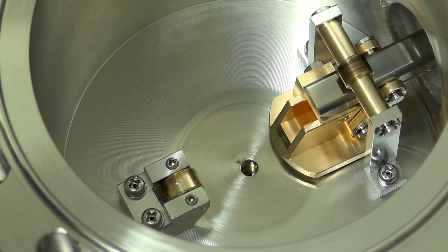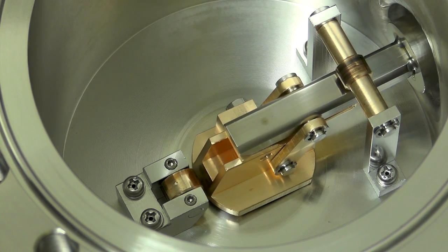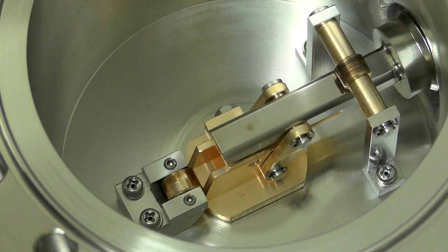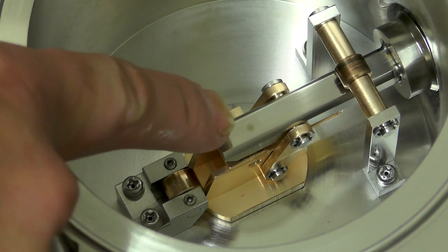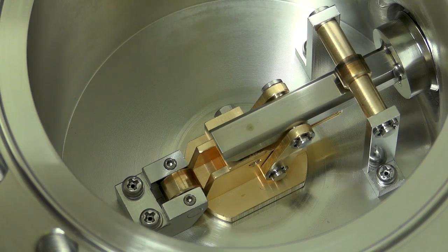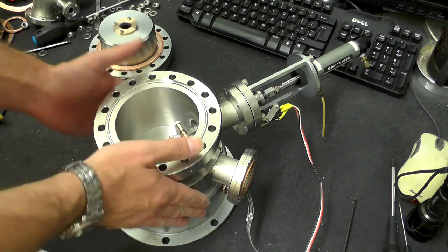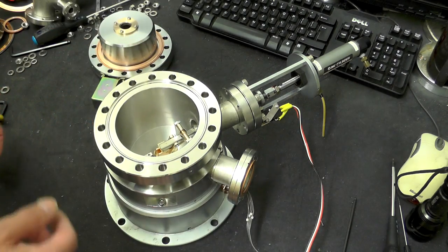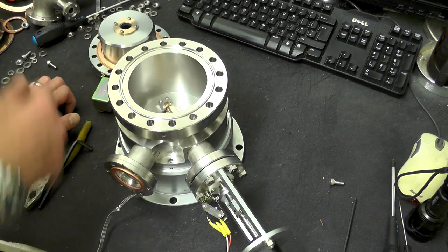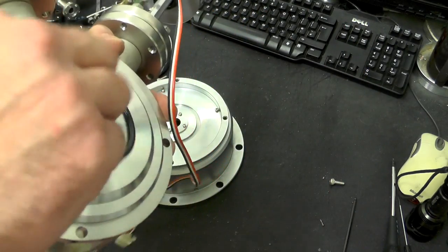When the piston is pushed forward it forces the copper plate to clamp down and seal the gap. In its fully retracted position it's clear, and you have the aperture through to the next section. When moved the other way it pushes across, touches on the wheel, and seals the gap. It's interesting — you can see a small burn spot on the top of the bar there, which is obviously a little bit of burn from the electron beam.